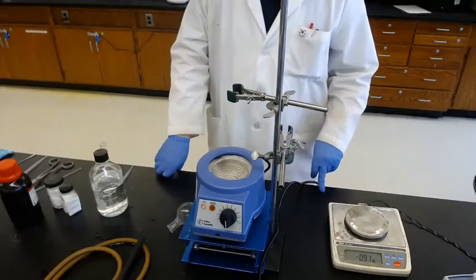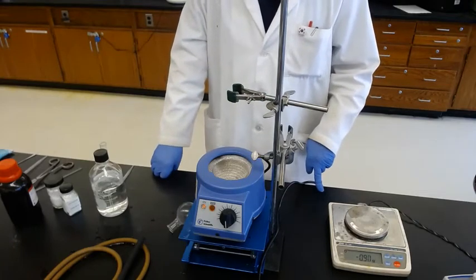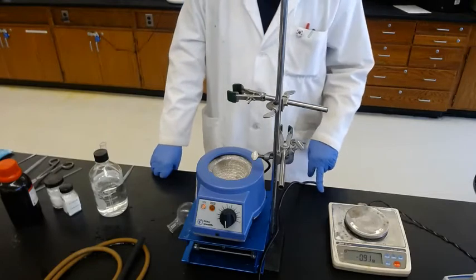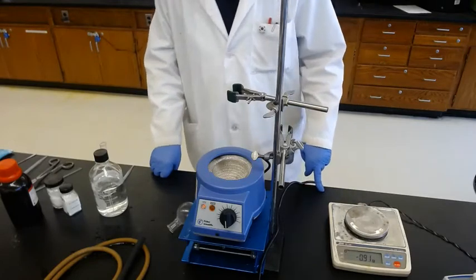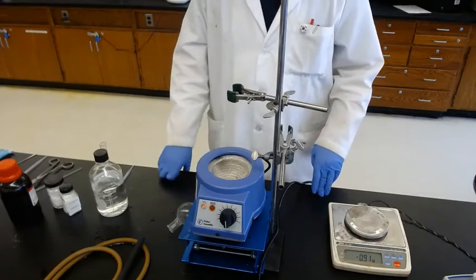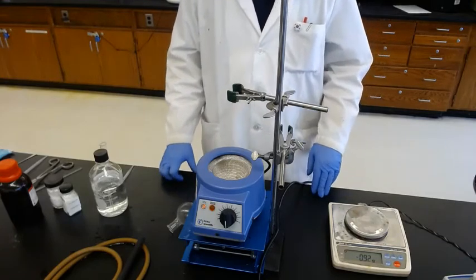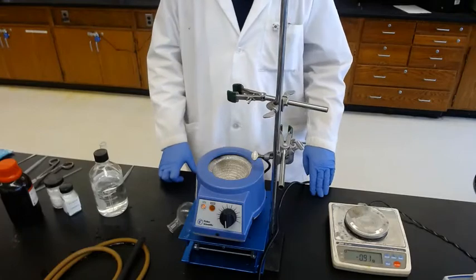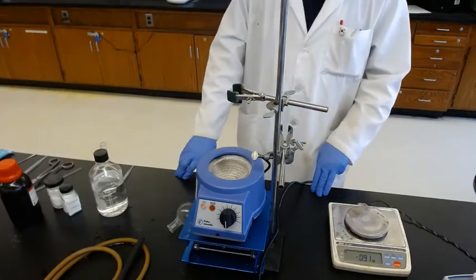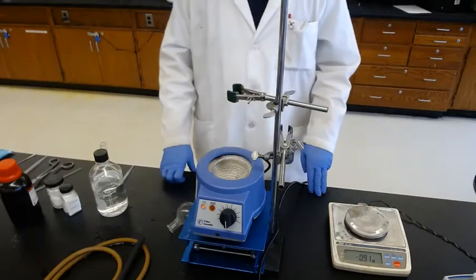Today's lab is Williamson ether synthesis — making an ether compound from an alcohol and an alkyl halide. Especially today, we're converting acetaminophen, which is the active ingredient of Tylenol, to phenacetin. So we replace the OH hydroxy group on the benzene ring of acetaminophen with an ethoxy group.